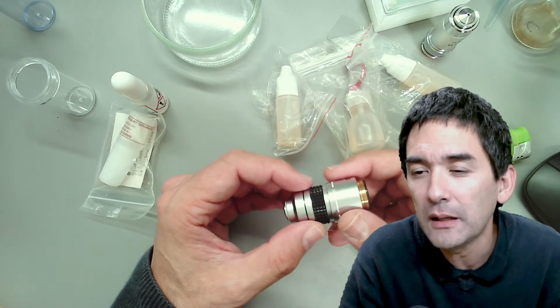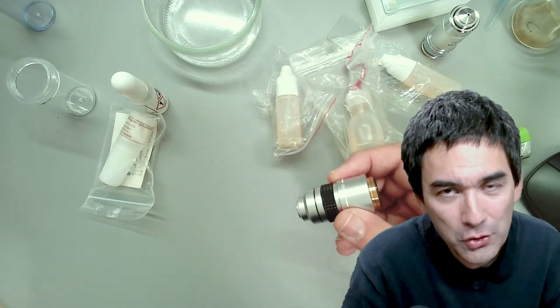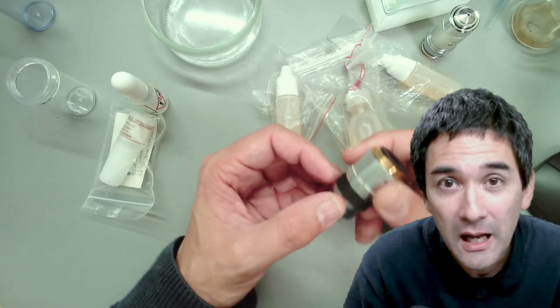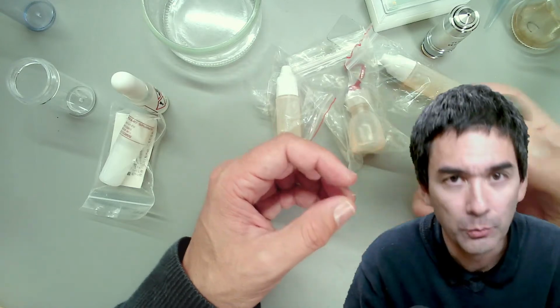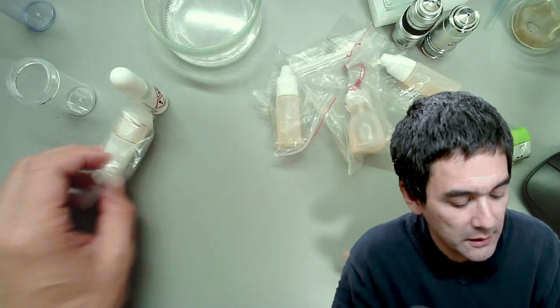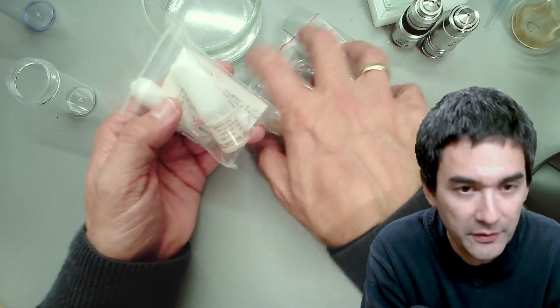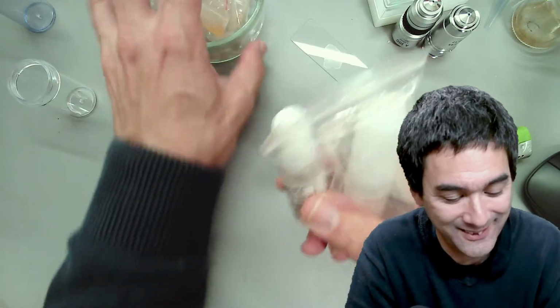About glycerin, I might try that, not on my good microscope. I'm really sensitive about that one, but maybe on the other microscopes that I have, I might try glycerin immersion too, because the objectives are not that expensive for those microscopes. Okay, so let's have a look. I will be using this here. I just wanted to show you, before I start preparing some of the specimens, what came along with this.